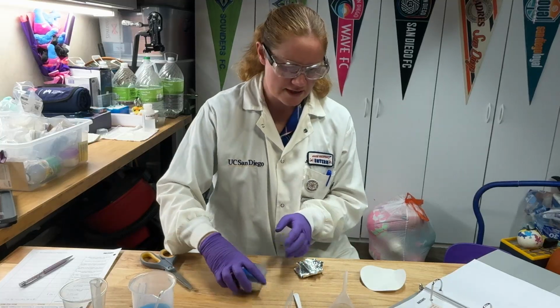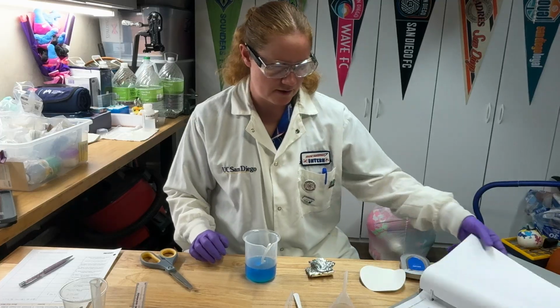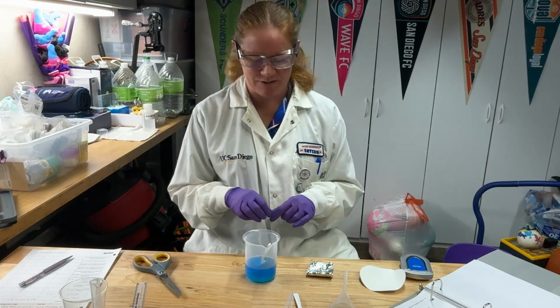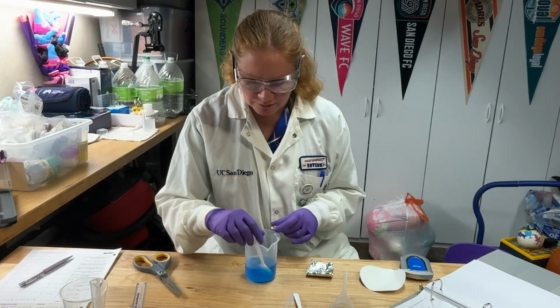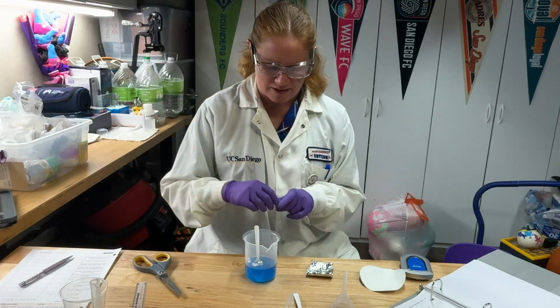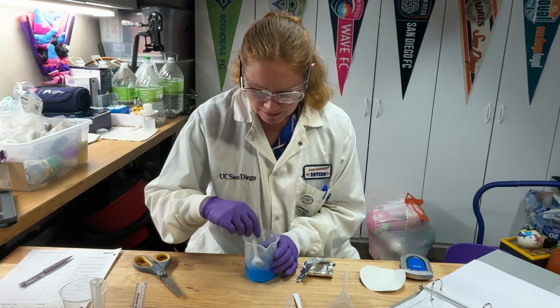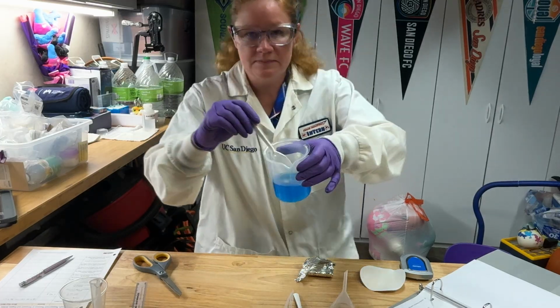Okay, now you are going to want to add this in small pieces to your beaker. You definitely do not want to just dump the whole thing in. If you just dump the whole thing in, it's not going to go very well. So we're going to start adding small pieces. And again, this may go a little bit slow, so I'm not going to go through the whole entire addition right now. I'm just going to add a little bit, see if I can get it going so you can see what it looks like. All right. Yeah. So I'm starting to get some bubbling and some fizzing.